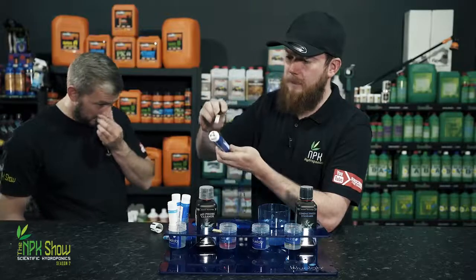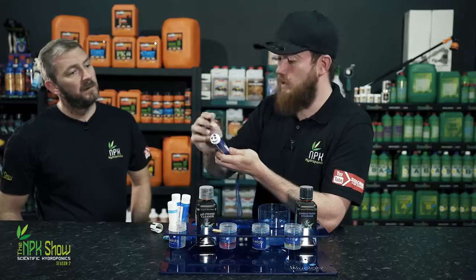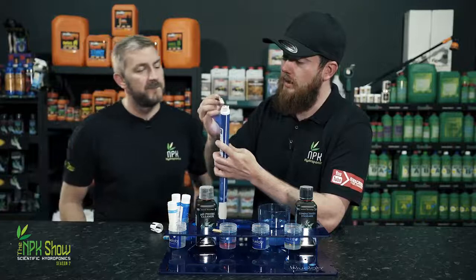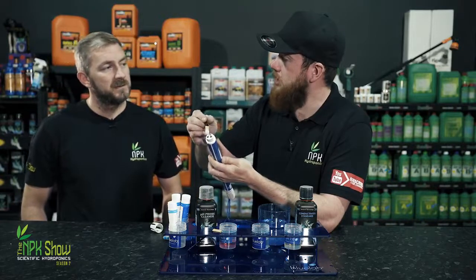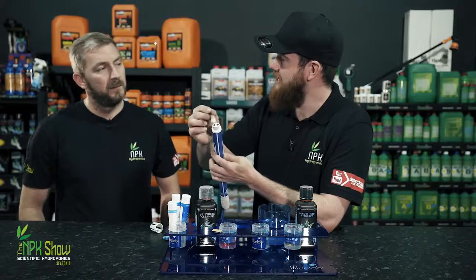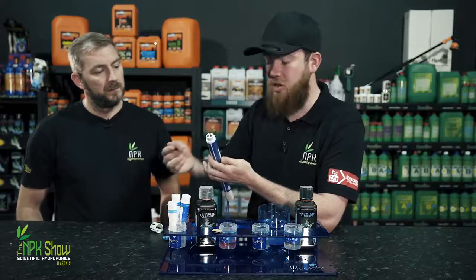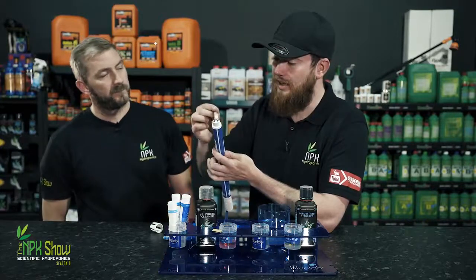What those are, you see the metal there is a temperature sensor. It'll take the temperature as well, which will help give an accurate reading of what the EC is. And the 2 carbon points there, pads, they will assess how well your water conducts electricity. The more nutrients you put in, which are salty, the quicker it will conduct electricity. The less salts, it won't conduct electricity.